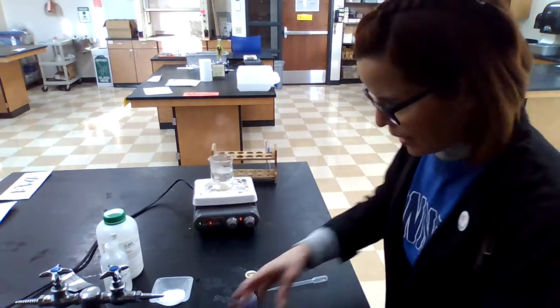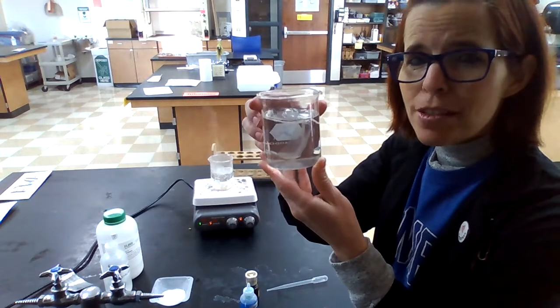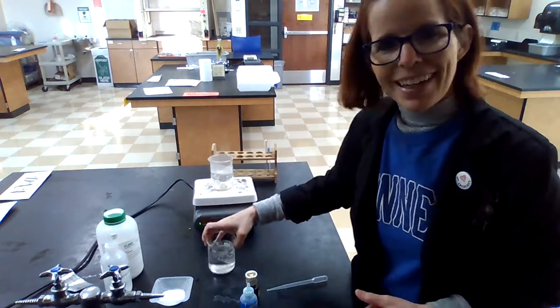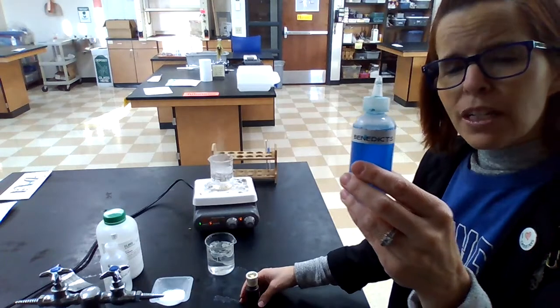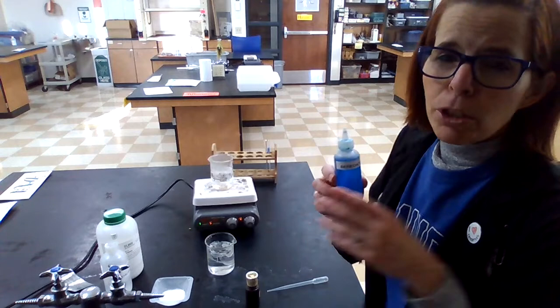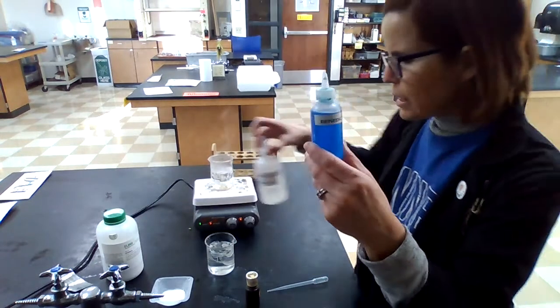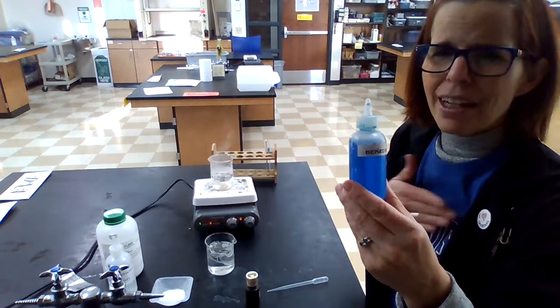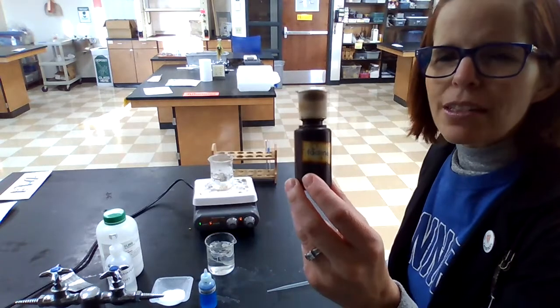It's been about 10 minutes. This has been soaking in the beaker, so hopefully diffusion is happening. If one of the molecules is smaller, it'll have escaped into the water and we'll be able to test for it. I have two tests. The first one is called Benedict solution — it turns different colors when it touches a sugar, anywhere from green to yellow to orange to red. And iodine is for testing for starch — iodine is normally a yellowish golden color, but if it touches starch it turns black or dark purple.